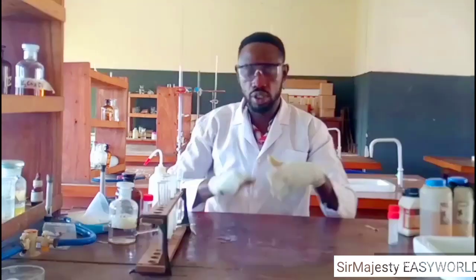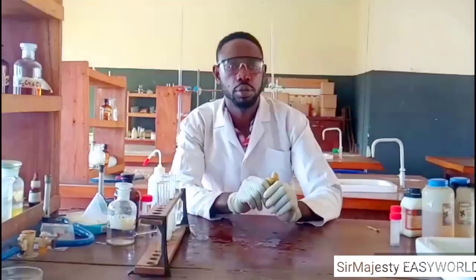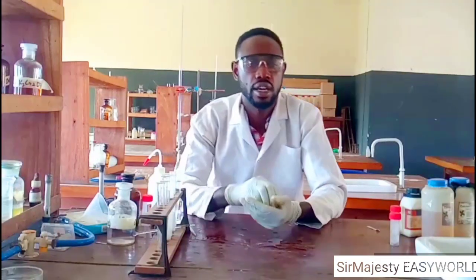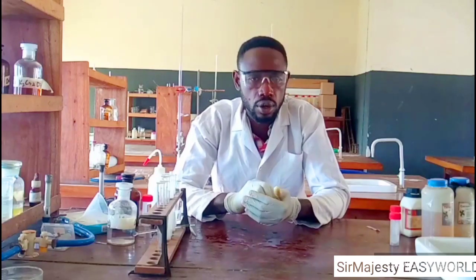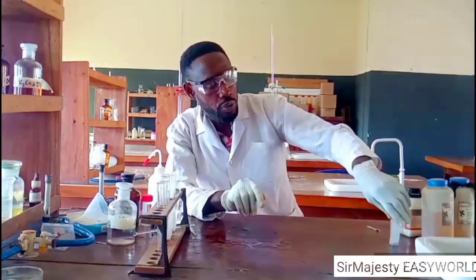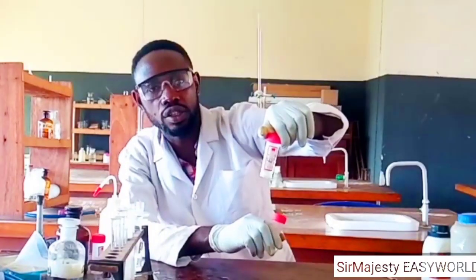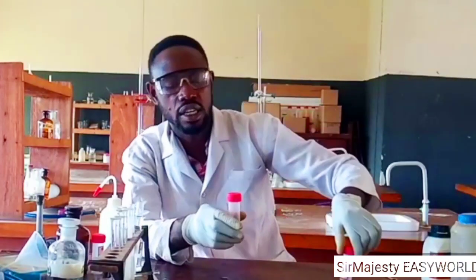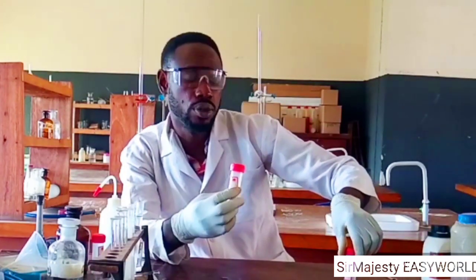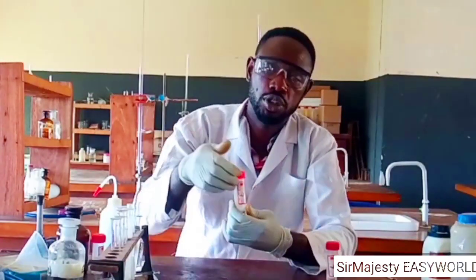So you should also learn how to test for chloride ion, because calcium chloride has chloride ion. In testing for chloride ion, you either use lead nitrate or silver nitrate. So it's possible that L will be used to detect the presence of chloride in E. Calcium chloride might be detected using L. How they may do this is that they just tell you, or you can do it yourself, get the first portion or second portion of this.